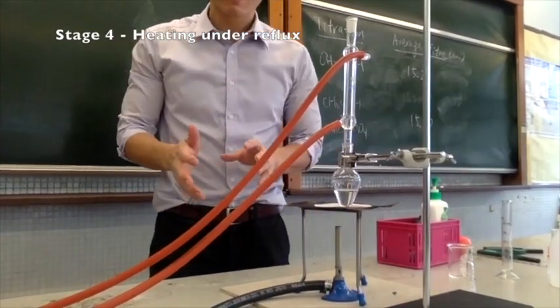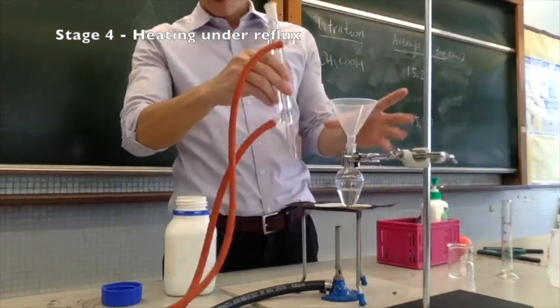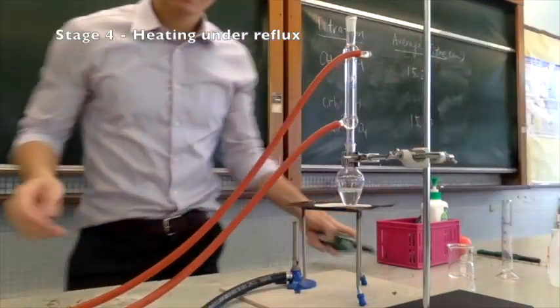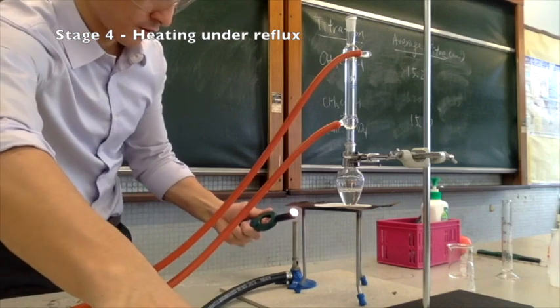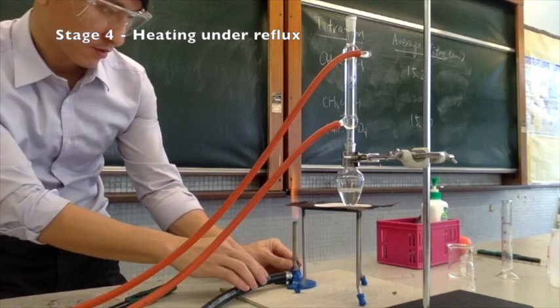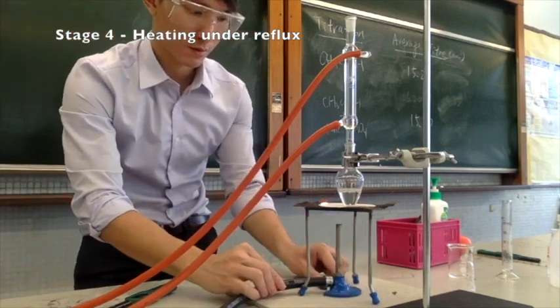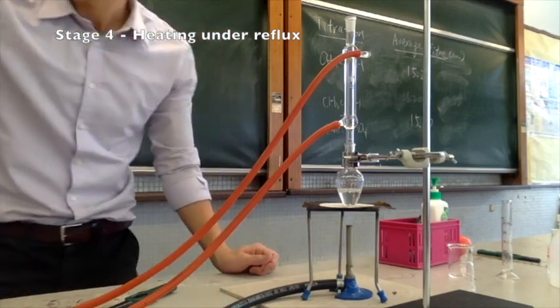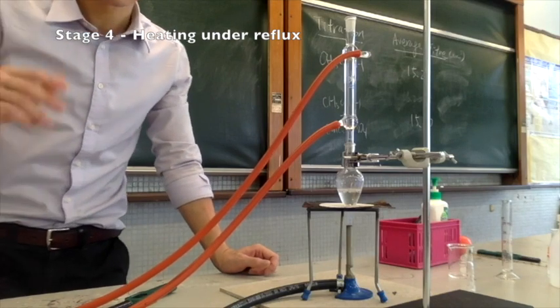Now, before we start our reflux, make sure you add the anti-bumping granules. Okay, light up the flame. And don't forget to open the water tap so that the condenser has water flowing through.